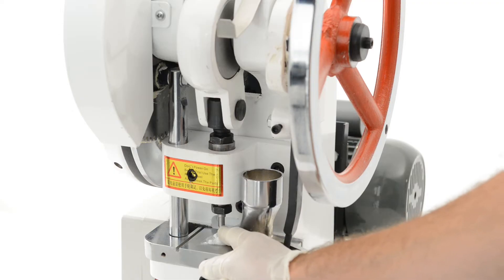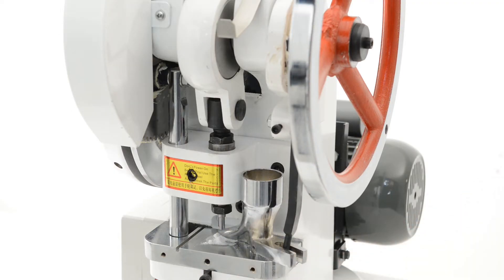If the tablet is too soft, you may first need to try increasing the punch pressure and then turn the machine over by hand. If that doesn't work, you may need to add more binders. If this is the case, recalculate the new ratio and do a new test mix.